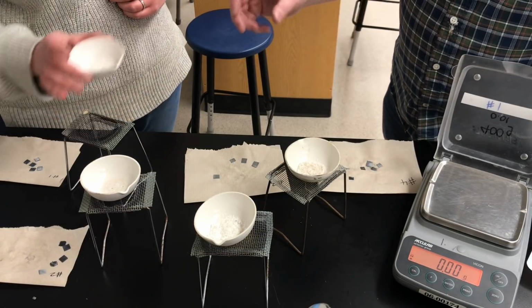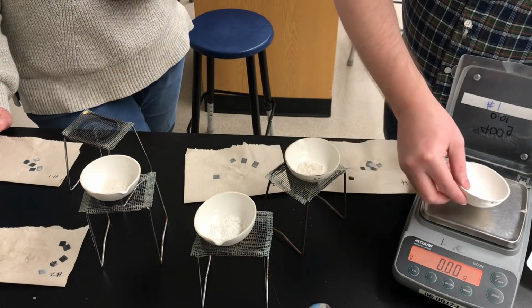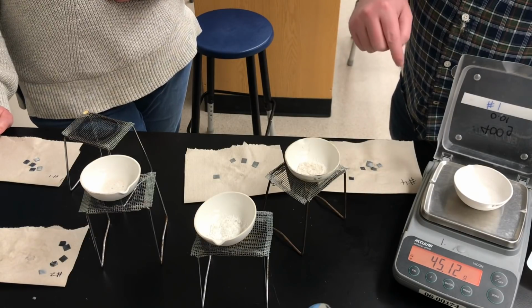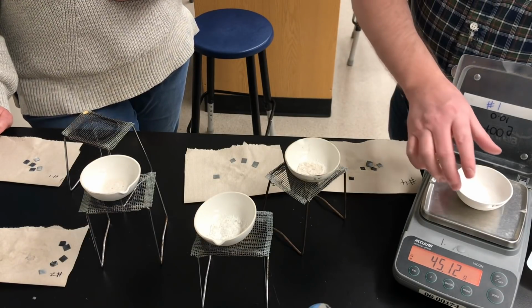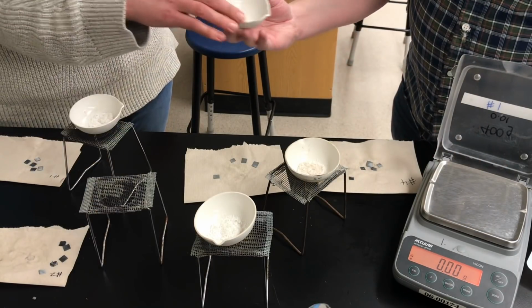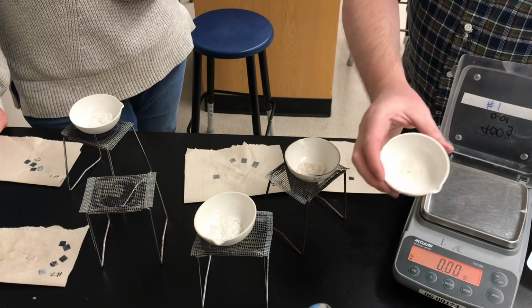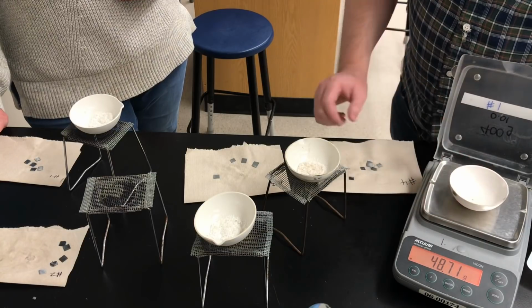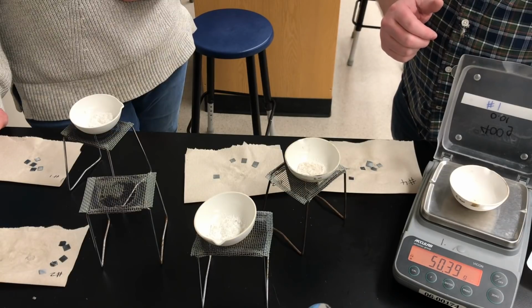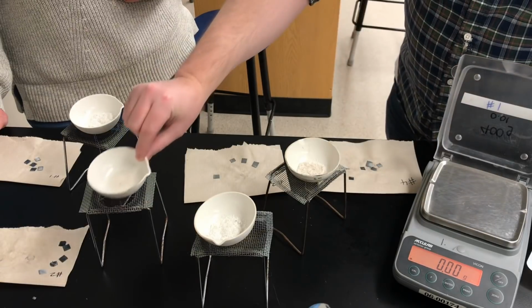So this was from test tube number 1. You can see the solid zinc chloride in that dish. So this is the mass of the evaporating dish with the zinc chloride salt produced. The second dish, the salt looks a little bit different. It's probably melted and turned liquid and then solidified again, but we know from the law of conservation of mass that melting would not affect the mass. So there's the mass of the second dish with its zinc chloride.